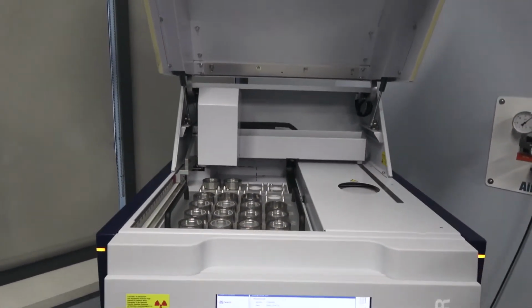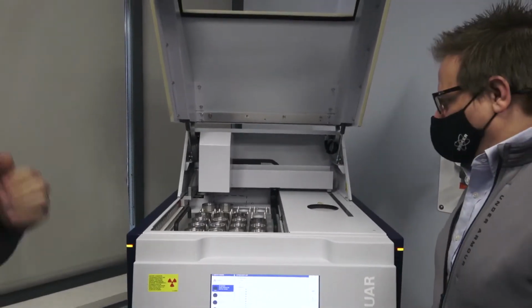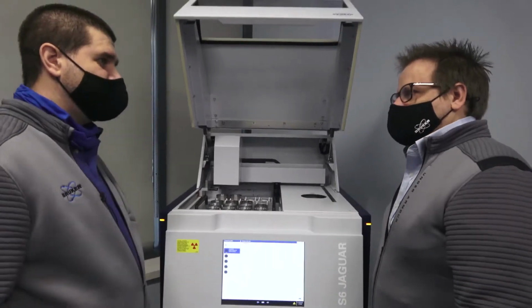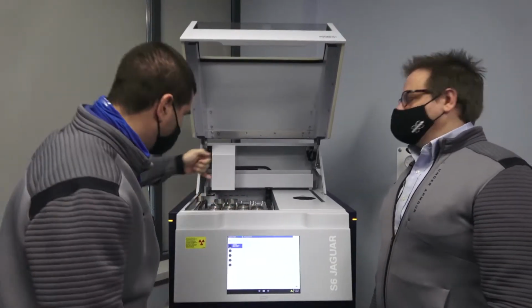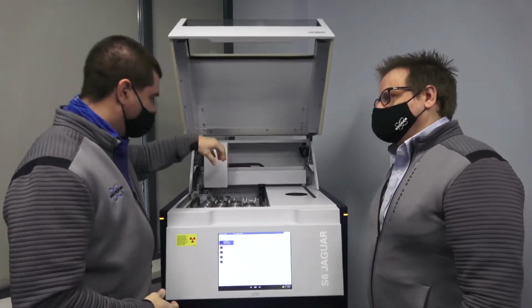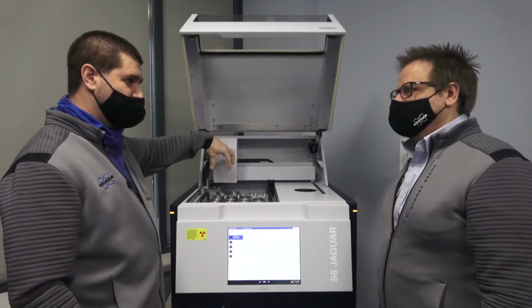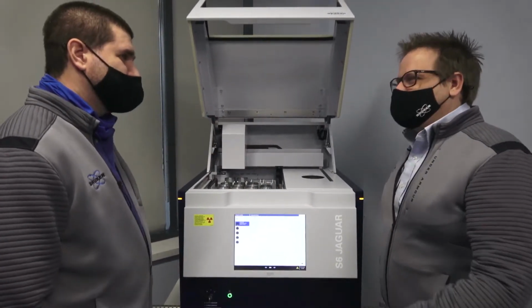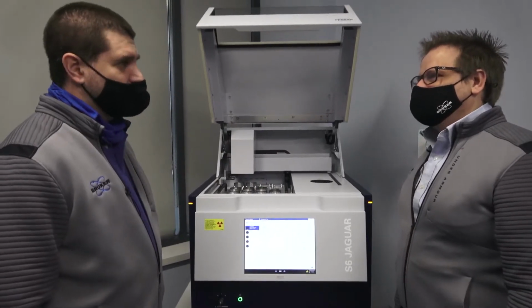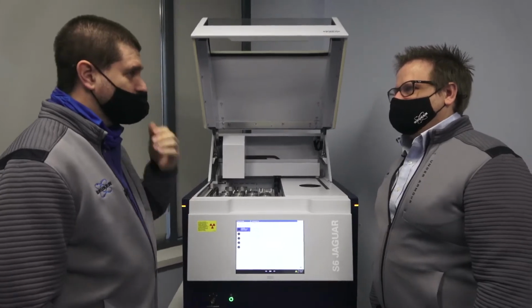Oh, wow. And it looks like there might even be a cutout back there, too? Yes, and that cutout is meant for automation samples. So there's some industries that have a belt going to the back of the system. That belt will come right back there, and the samples will come in through that belt, and the sample handler will pick it up and put it directly into the chamber for you. So that might be somebody in cement or something like this, right? That's one of the main industries that uses it. Yeah, cement industry and maybe some geological places as well.